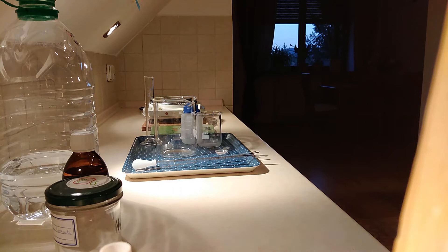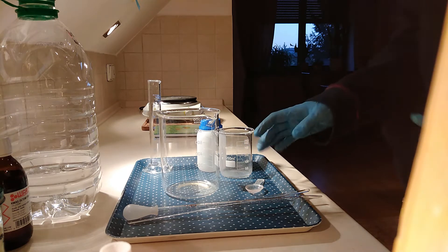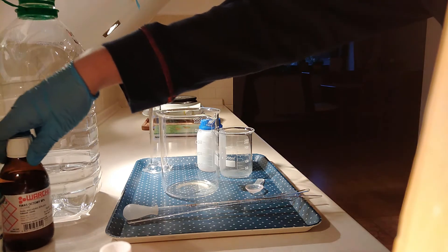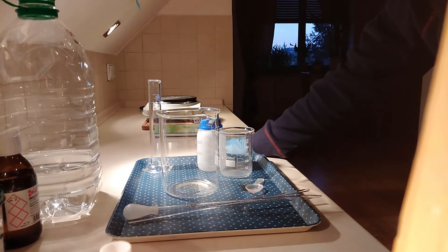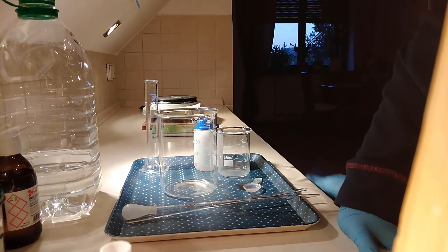Today we're gonna be making sodium acetate, as I said. We're gonna do it in quite a strange way, because I want to neutralize all of the acetic acid and not boil off any concentrated vinegar into the air.